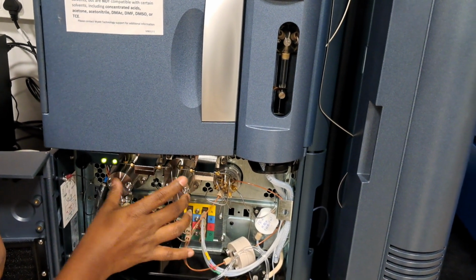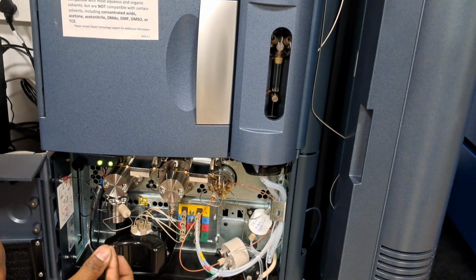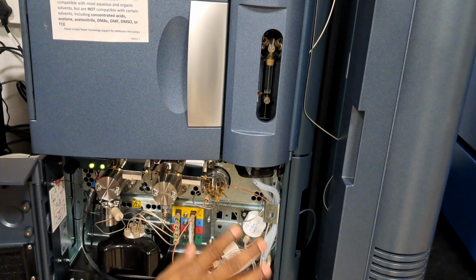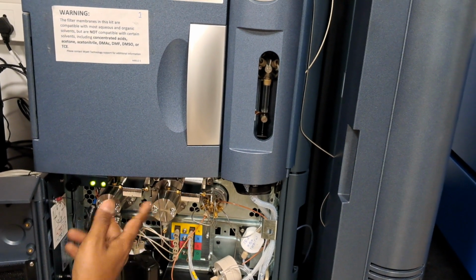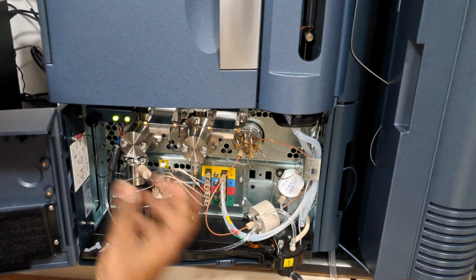If you immediately start the priming, the pump will move fast, and at that time the seals get buffer particles and salts. So first seal wash, then pump priming. Irrespective of whether you are using A channel or B channel, first start with the seal wash. It takes out all the precipitated salts. It goes drop by drop only. It washes the pump heads actually. Then you can do the pump priming.